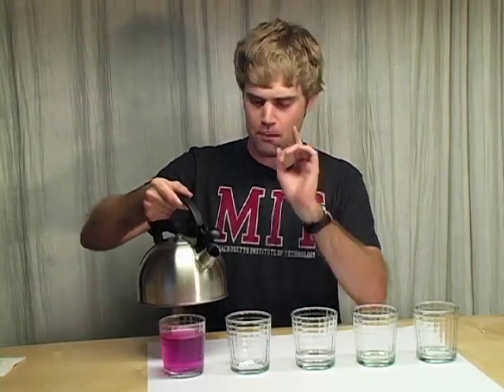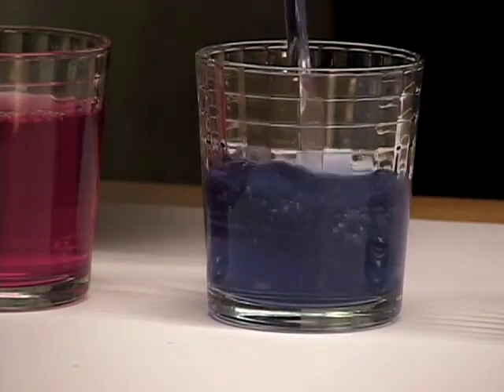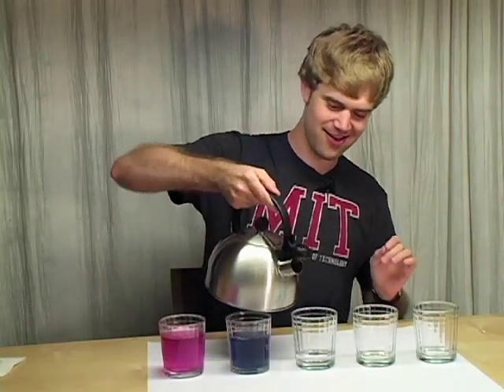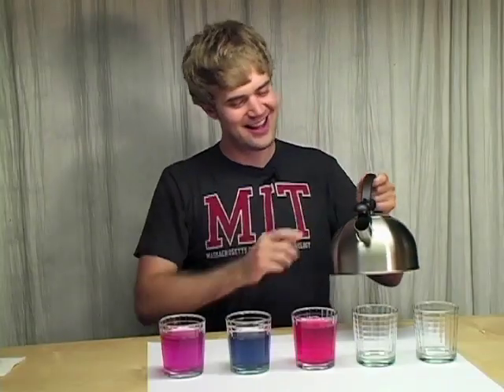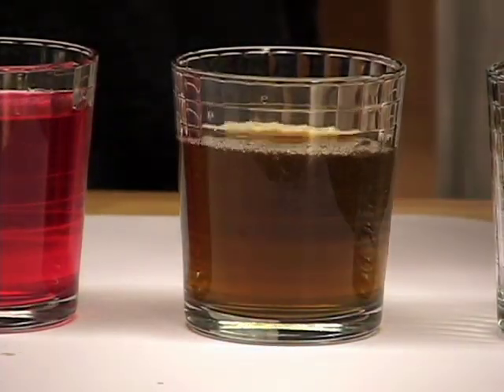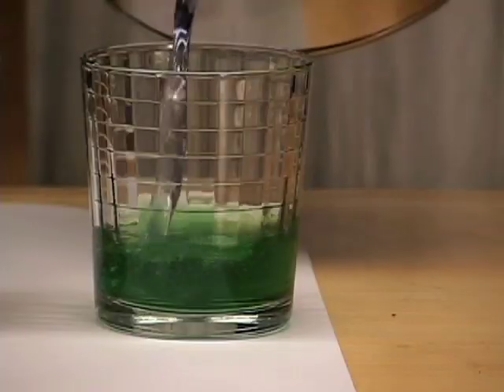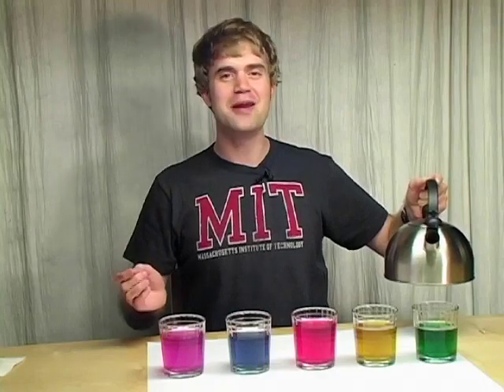Pink — hey, not bad. Okay, blue, red. How about green — no, I mean yellow. And then green. So there we go, a rainbow of colors.